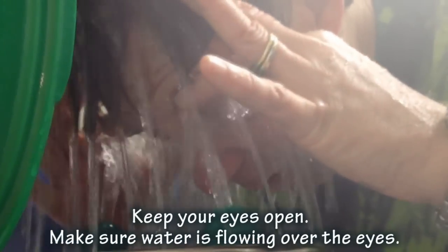Keep your head in there, you gotta rinse it all out! Wish I wore my safety glasses! Make sure your eyes are open. Keep your eyes open with your fingers if you need to.